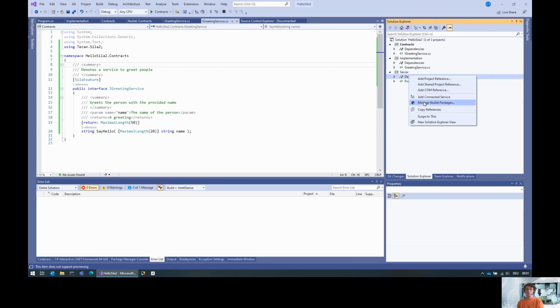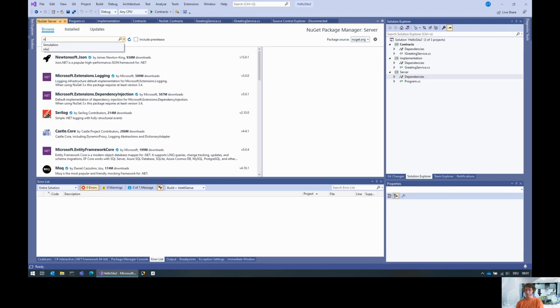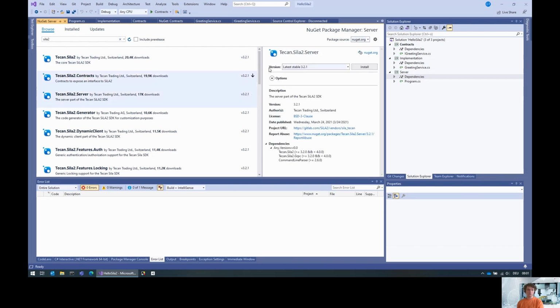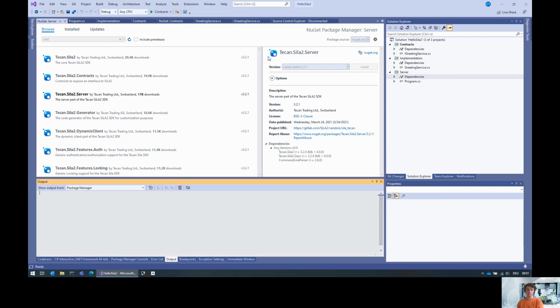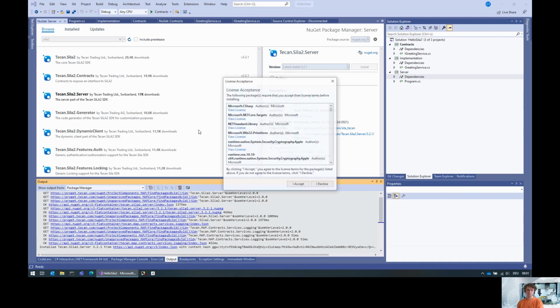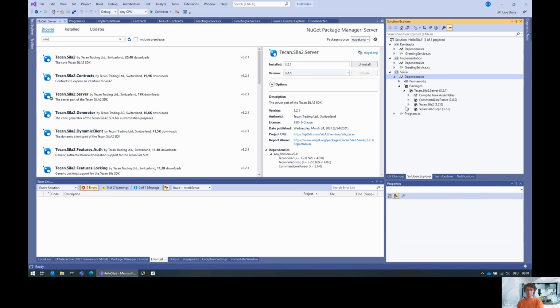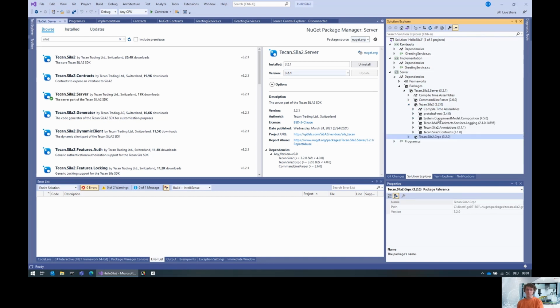So for the server, this is going to be the one project that knows that we want to expose this contract to SiLA 2. So here we download a different package, namely the Tecan SiLA 2 server package. This comes with a couple of dependencies, because you see here we've got the actual core SDK, the server package, the gRPC package, and they have other dependencies like Protobuf, the system component model composition, the logging contracts, the annotations that we mentioned earlier, and a couple of contracts.